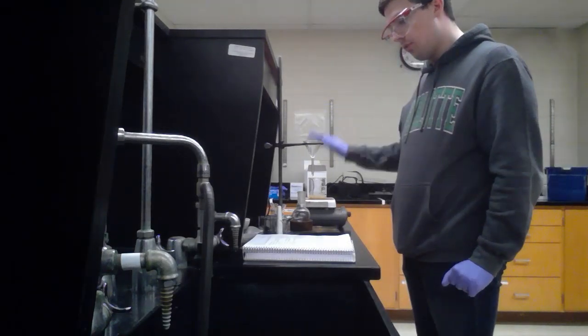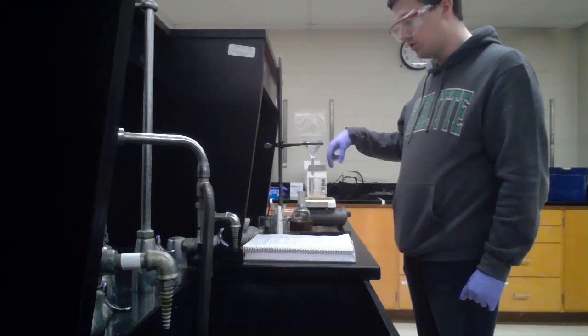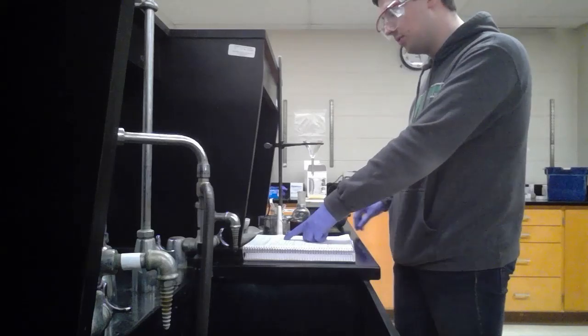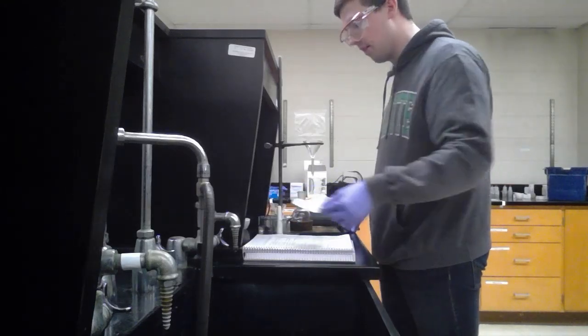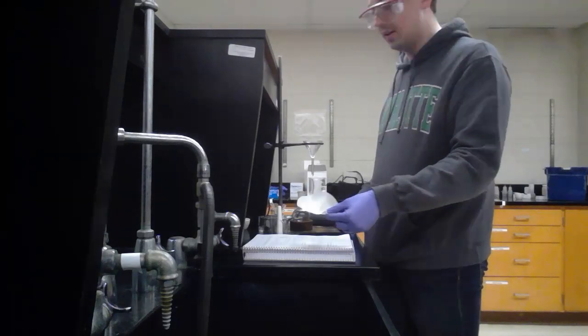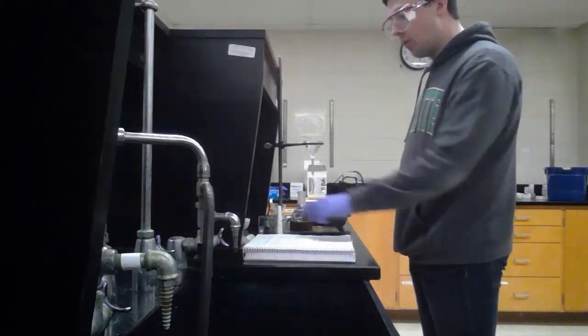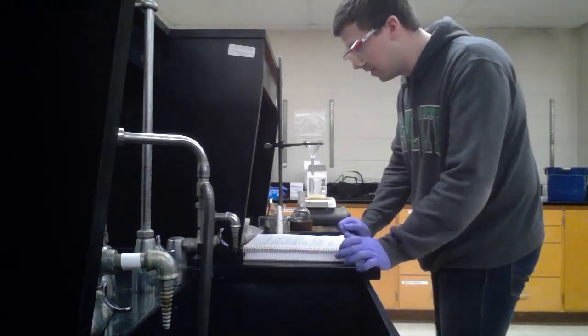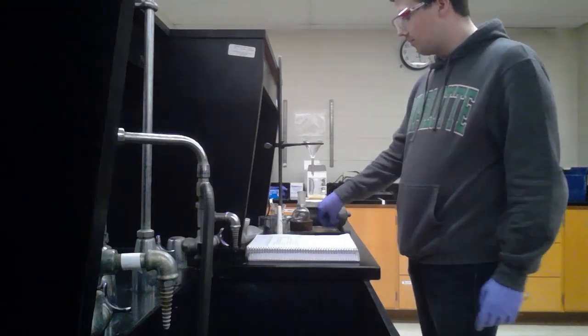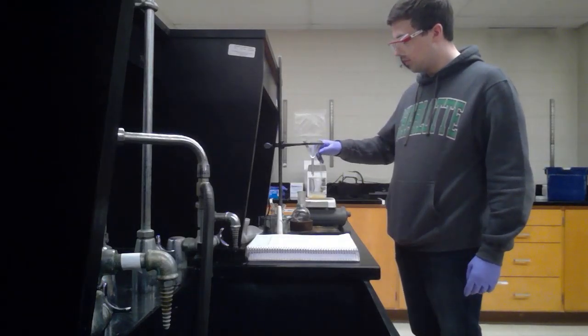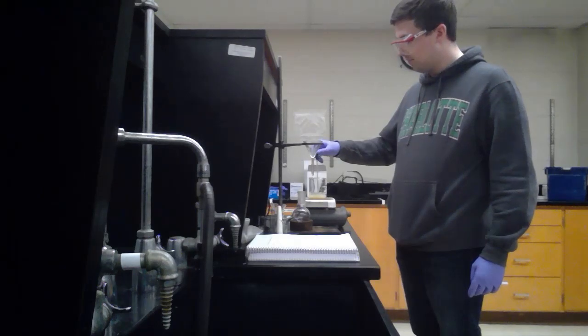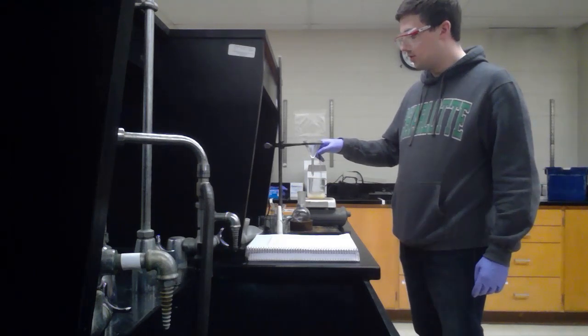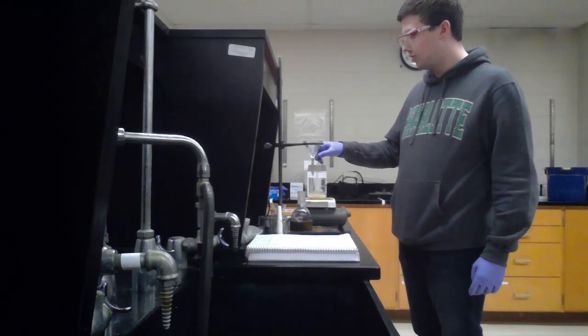Also over here, I wanted to mention that the beaker itself, just the 250 milliliter beaker and filter, is 98.98 grams. And the coffee filter by itself, before we got started, was 0.9 grams. So 0.9 grams for this and 98.98 for this. But so we're just going to let this stir for a little bit. We're once again just trying to get whatever salt we're going to get out of there. And this will eventually be centrifuged.